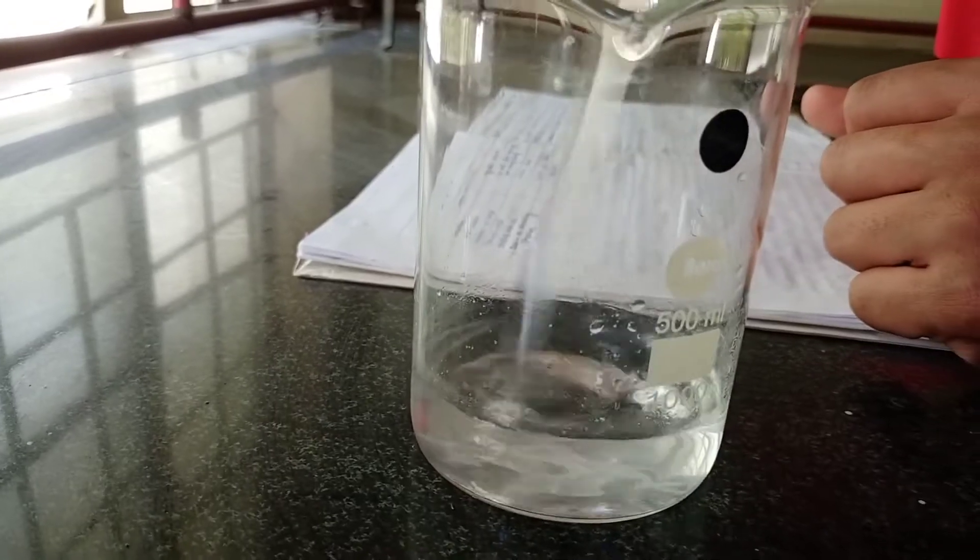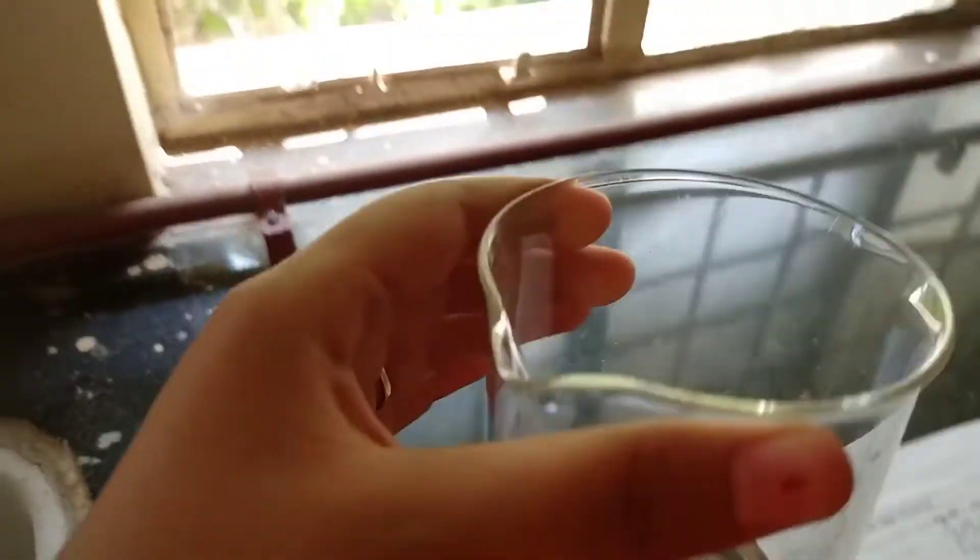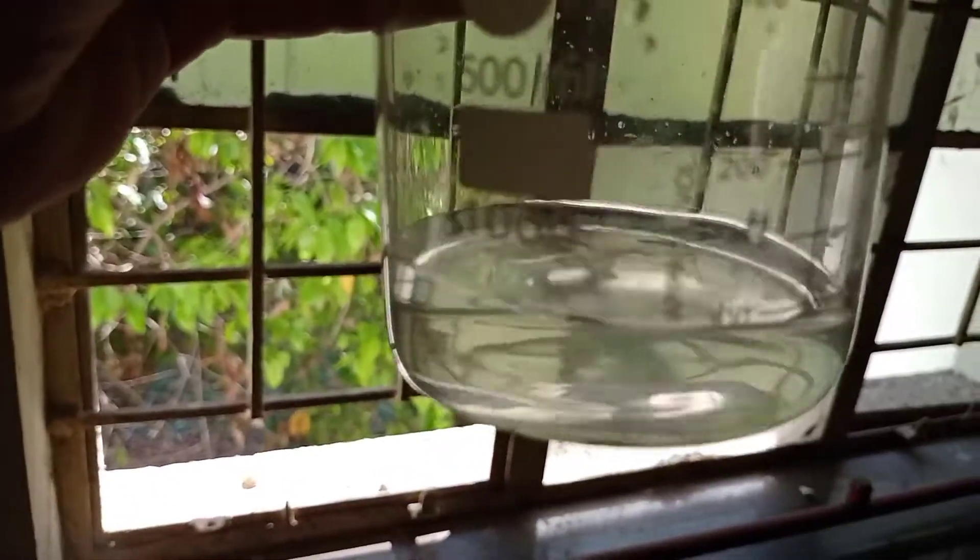We have to mix well. Here is our final result, this is our camphor water which is prepared.